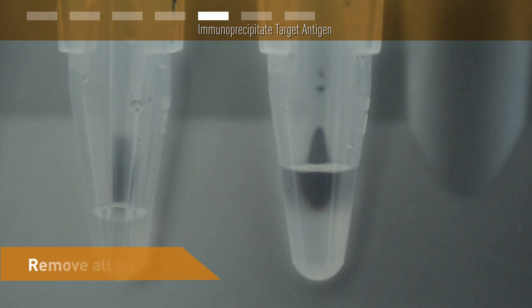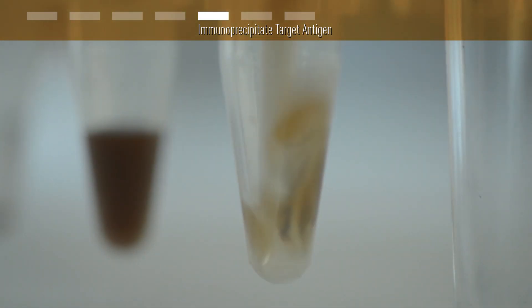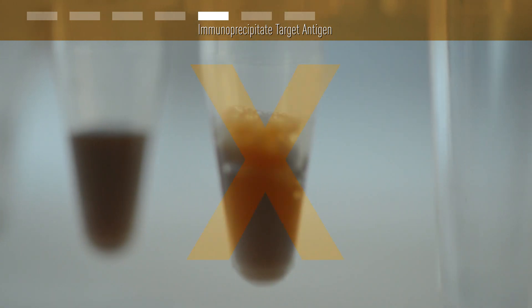Now you can remove all buffer without the risk of losing any of your sample. Magnetic separation allows for very easy washing. Here's a tip. When you re-suspend the beads, you should not introduce air. You don't want to risk losing any protein bound to the few beads that might get trapped in that foam.